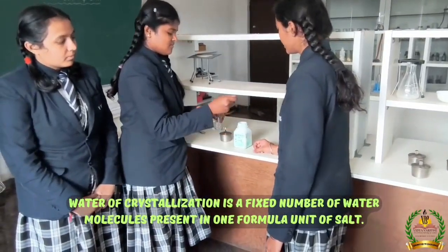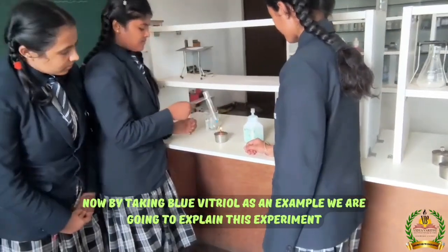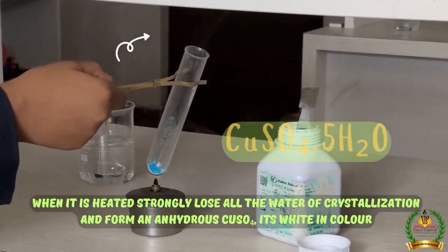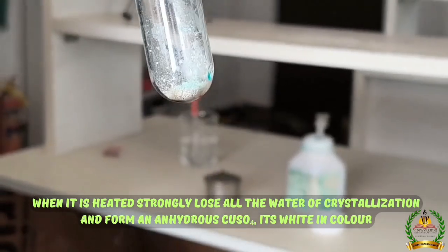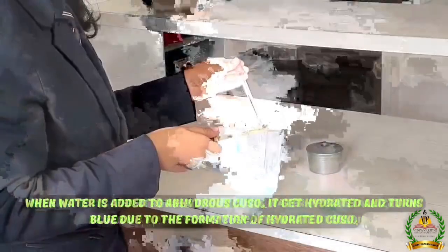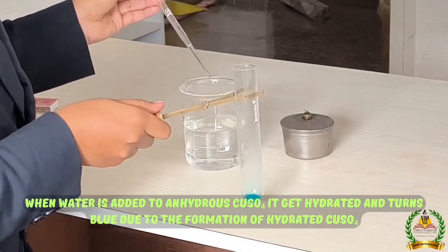Water of crystallization is the fixed number of water molecules present in one formula unit of salt. Now, by taking blue vitriol as an example, we are going to explain this experiment. CuSO4·5H2O is blue in color. When we heat it strongly, it loses all the water of crystallization and forms anhydrous CuSO4. It is white in color. When water is added to anhydrous CuSO4, it gets hydrated and turns blue due to the formation of hydrated CuSO4.